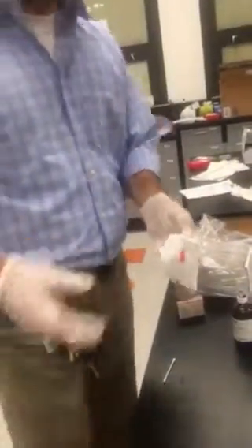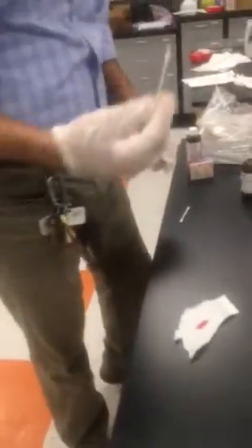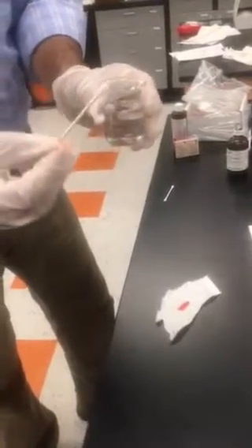So then the second method that we're going to talk about is how do we swab a blood stain, right? It's not often at a crime scene we see fresh blood that's wet still. Often you'll find dried blood on clothing or on carpet or whatnot. So what we're going to do is we're going to take another forensic swab, and we're going to this time wet it with distilled water. We want to make sure it's distilled water so there's no impurities.